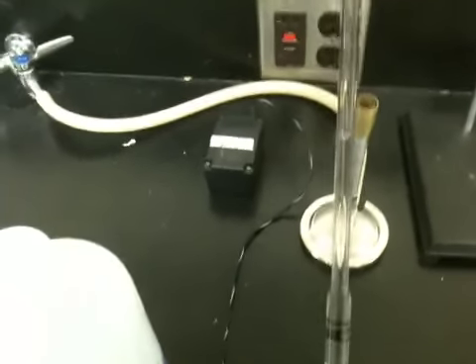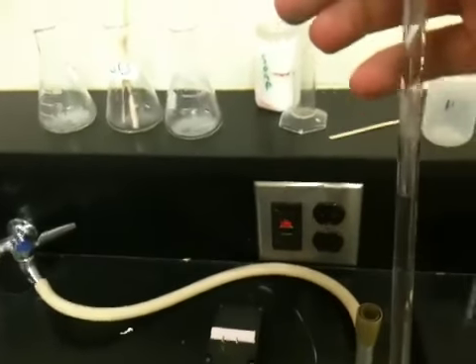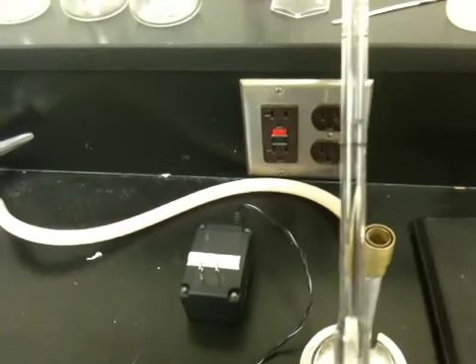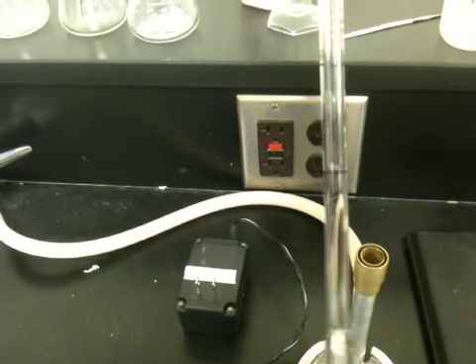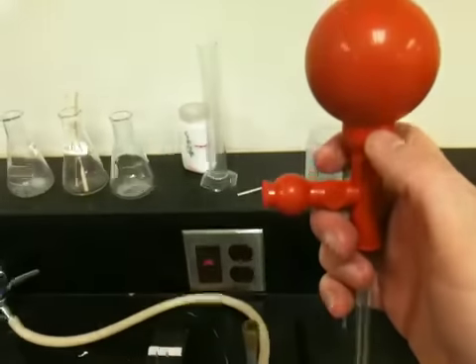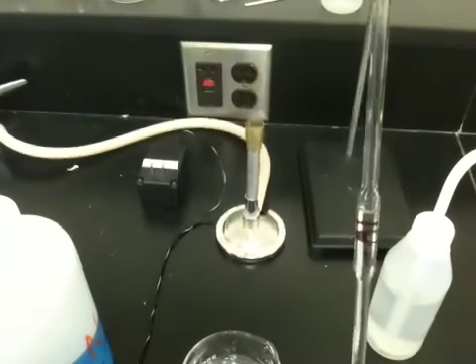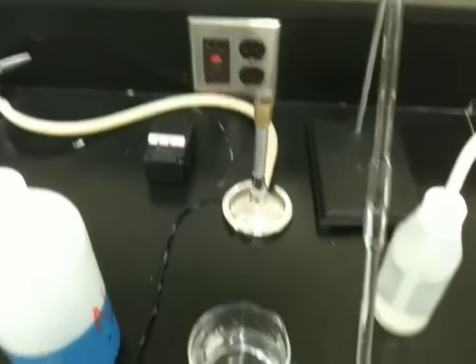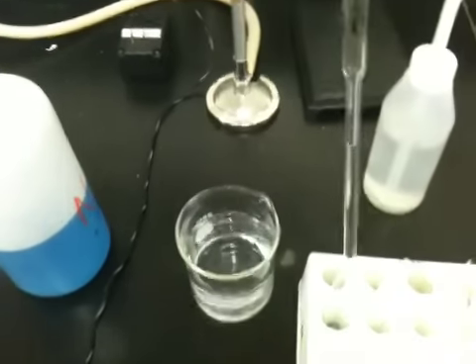So I'm going to have to let the liquid out. I push this valve, and I carefully pinch it so that the liquid descends slowly till it's at that line. And if I go too far, I can always draw it back up again using the other valve I showed you. Oh, there we go, I'm right on the line. Now I'm ready to transfer my liquid into something like a test tube. I'm going to let the air push the water back down into the test tube by pinching that valve. Takes a little practice, but you get used to it. Now that's one way I can transfer liquid using a volumetric pipette.